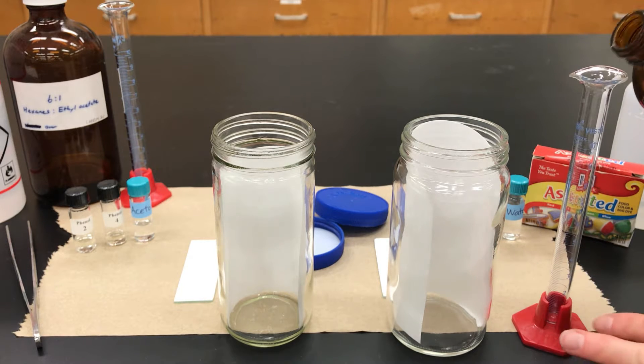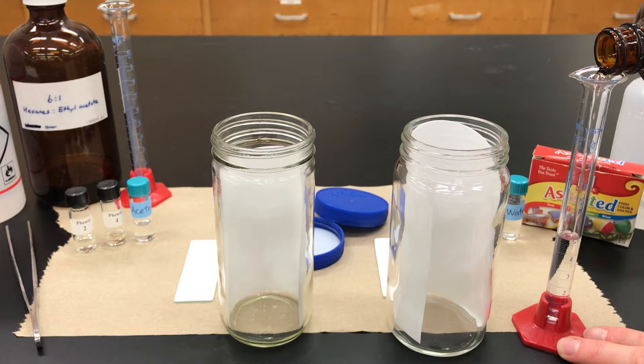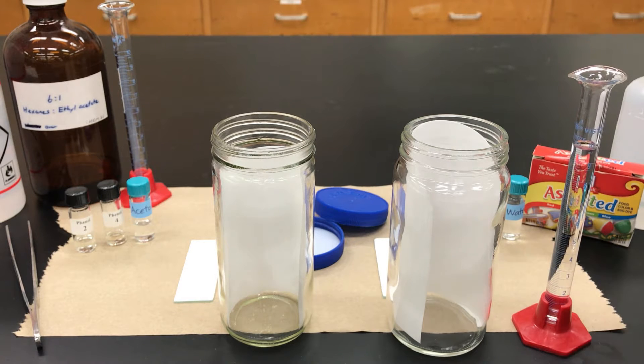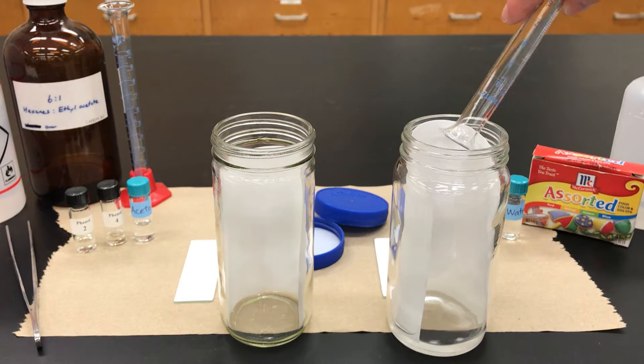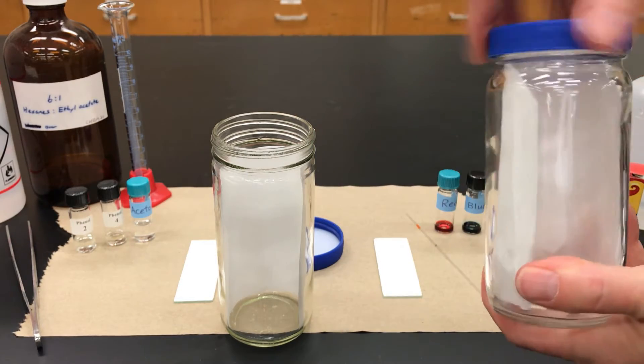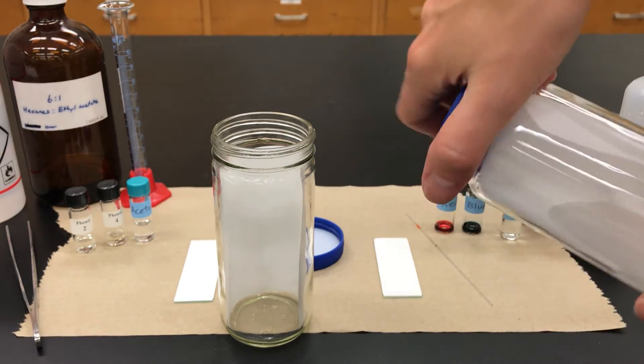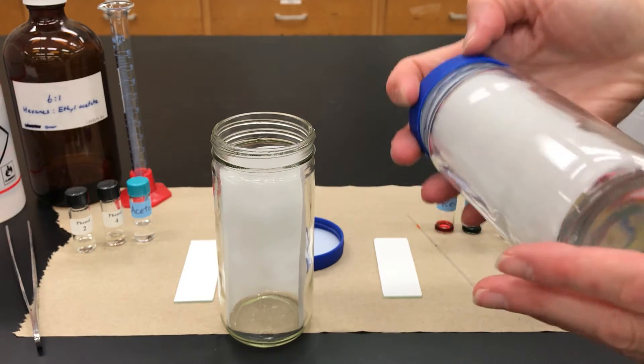So I'll pour that in and then I'm going to close the cap, screw on the cap, and jostle around the chamber to wet the filter paper and start to get the whole thing saturated with solvent vapors.